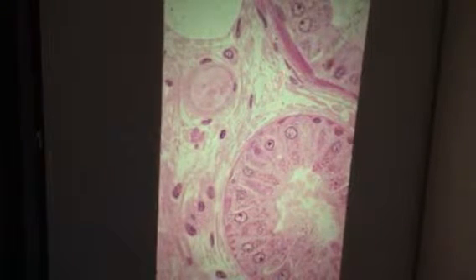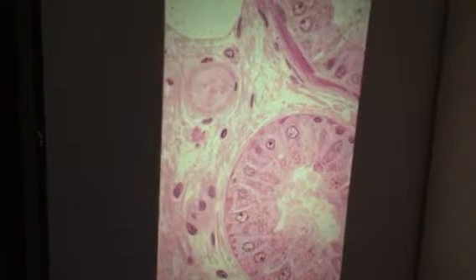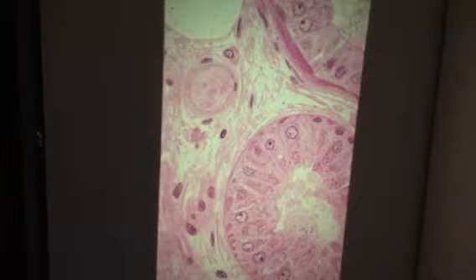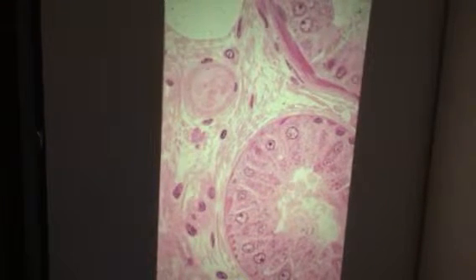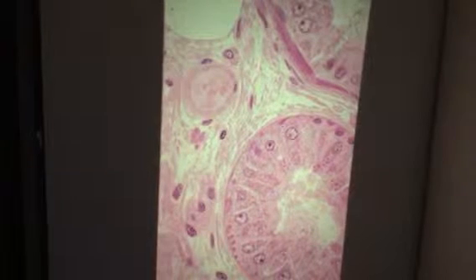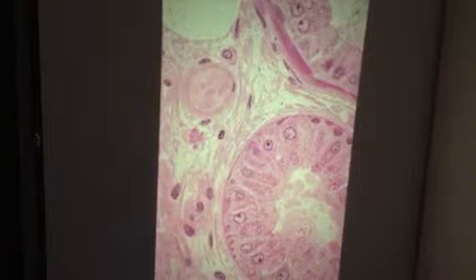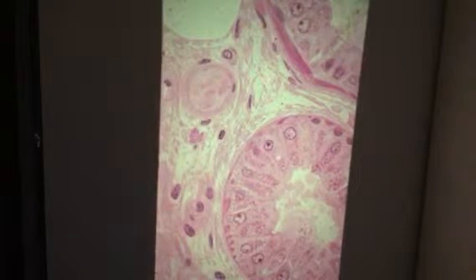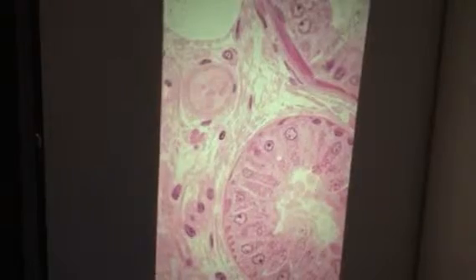And right here, what is this tissue we see right there? Loose connective tissue. And right there, and possibly right there, and right there, those nuclei are the nuclei of what particular cell? Fibroblasts. And what are these acidophilic things we see in there? Collagen, yeah, collagen fibers.